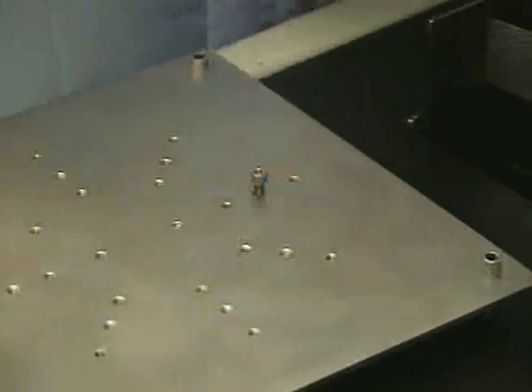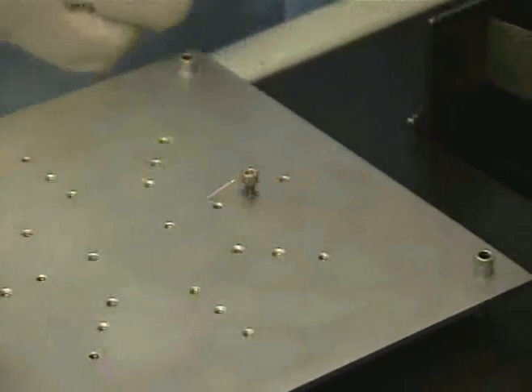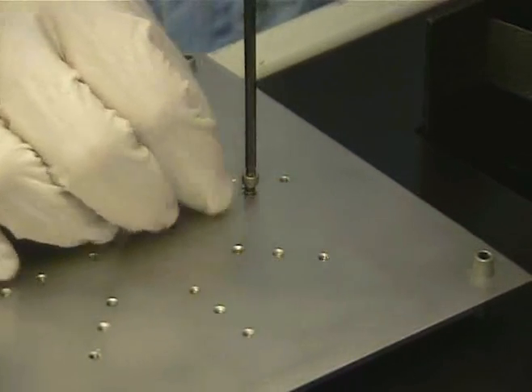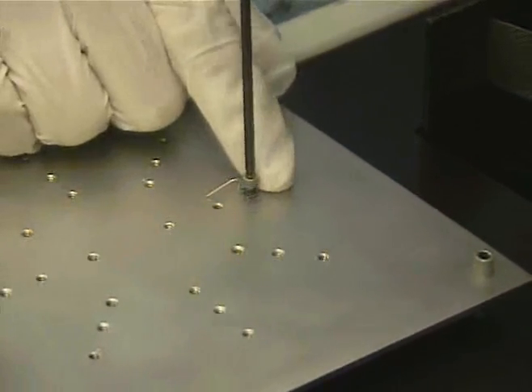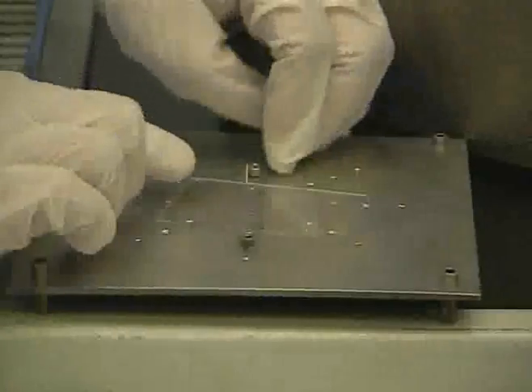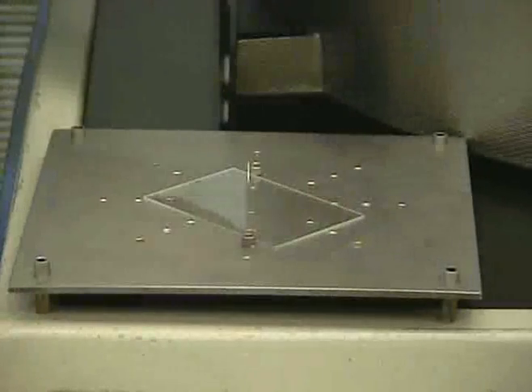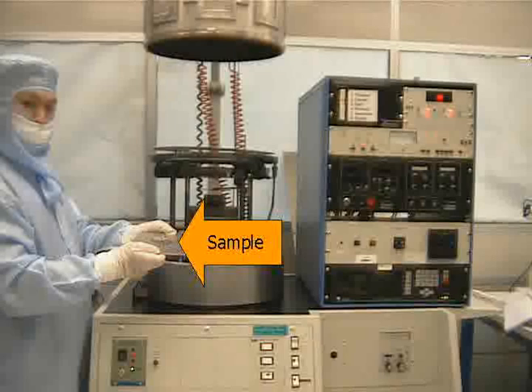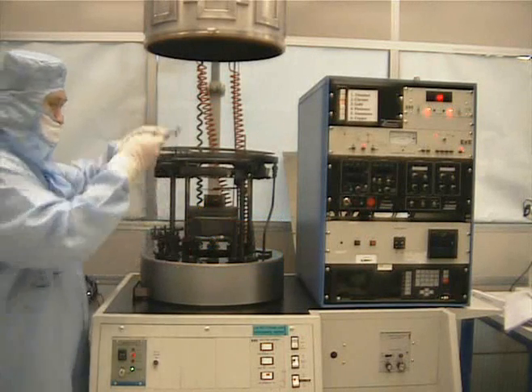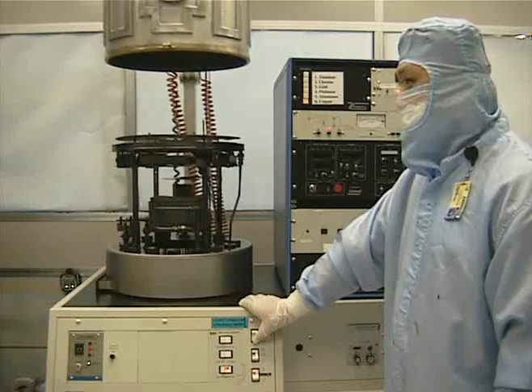First, get a sample holding plate and place a screw in it. Then place a sample holding clip around the screw and tighten down the screw. Repeat this process for at least one more screw. Then place your sample on the sample plate and put the clips on top of the sample. This holds the sample in place. Then place your sample plate on top of the sample holder. Be sure to place your sample facing down.